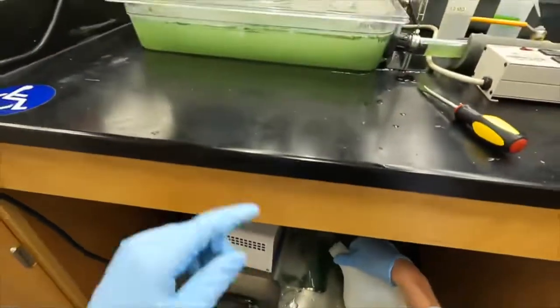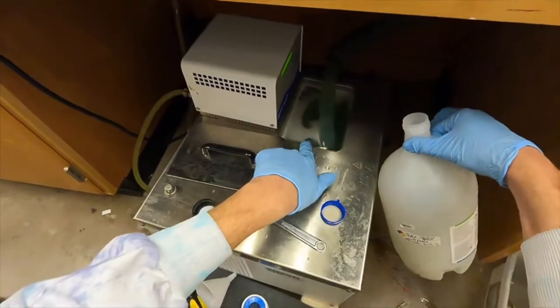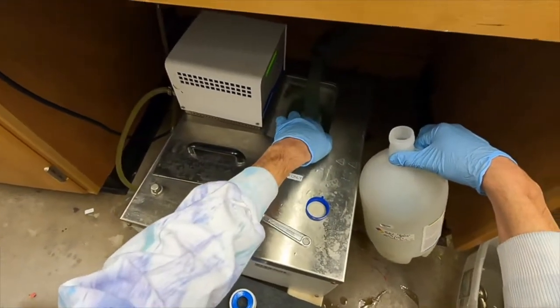The more this fills up, the slower this will start to decrease in volume, so you kind of just let it sit for a second.